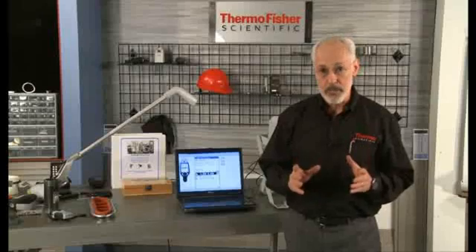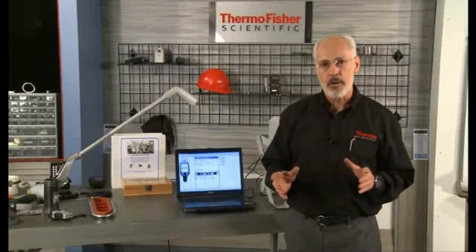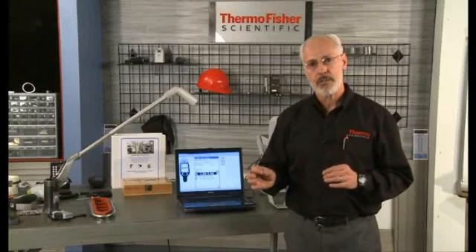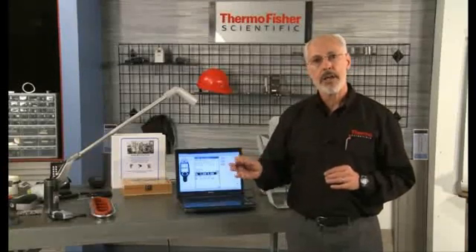The Niton XL3T Gold software will display both the separate analysis result for each of the residual elements as well as the combined sum of the 3. The software also has the ability to present a pass, less than 2,000 ppm, analysis in green, or a fail, greater than 2,000 ppm, analysis in red on the instrument display.